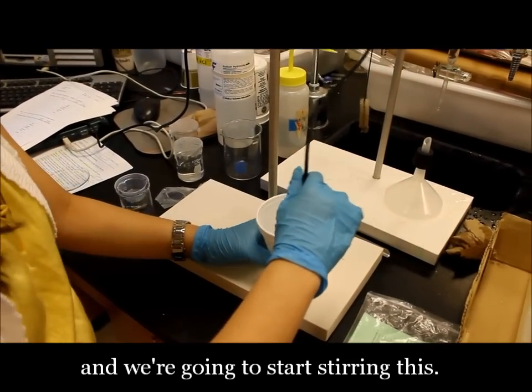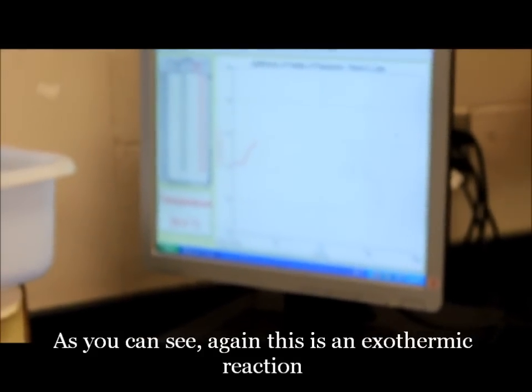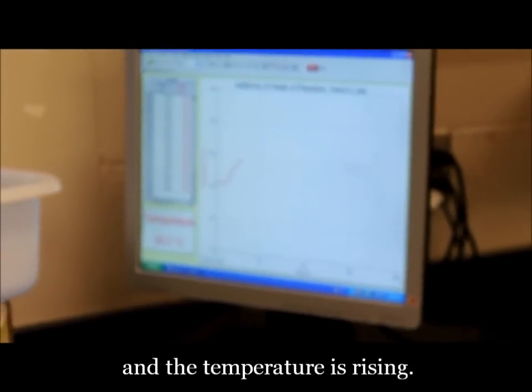Then we're going to start stirring this. So you can see this again is an exothermic reaction, and the temperature is rising.